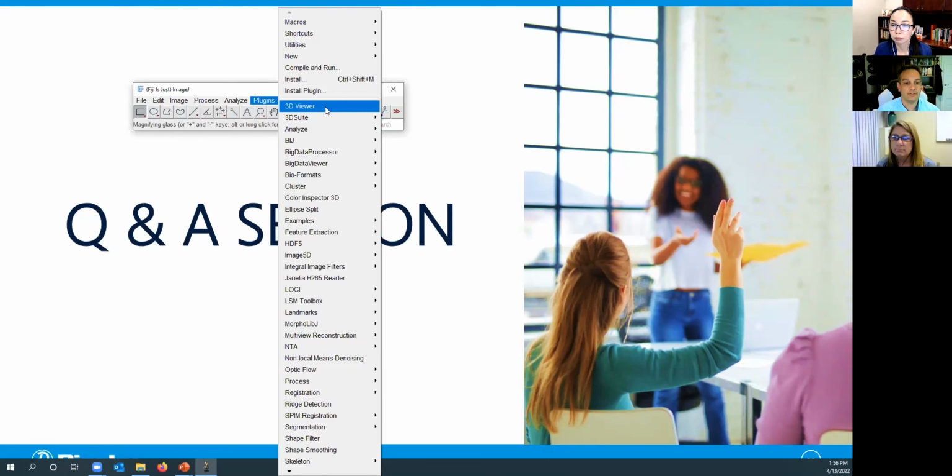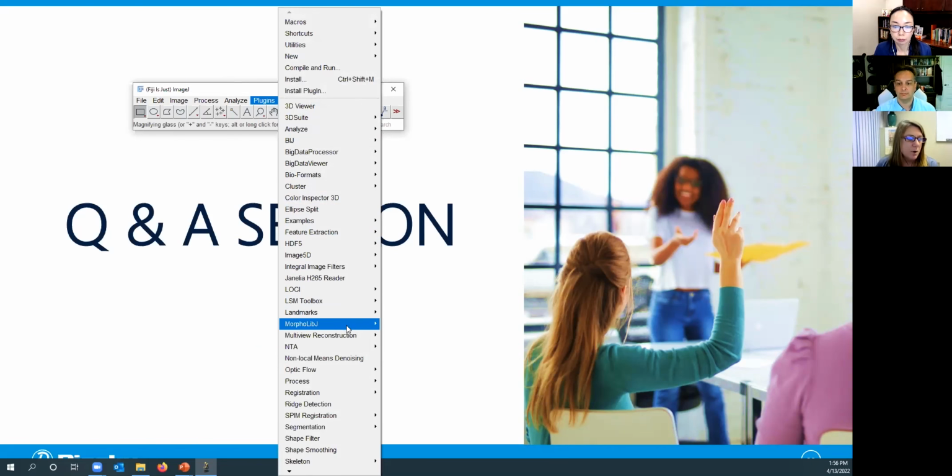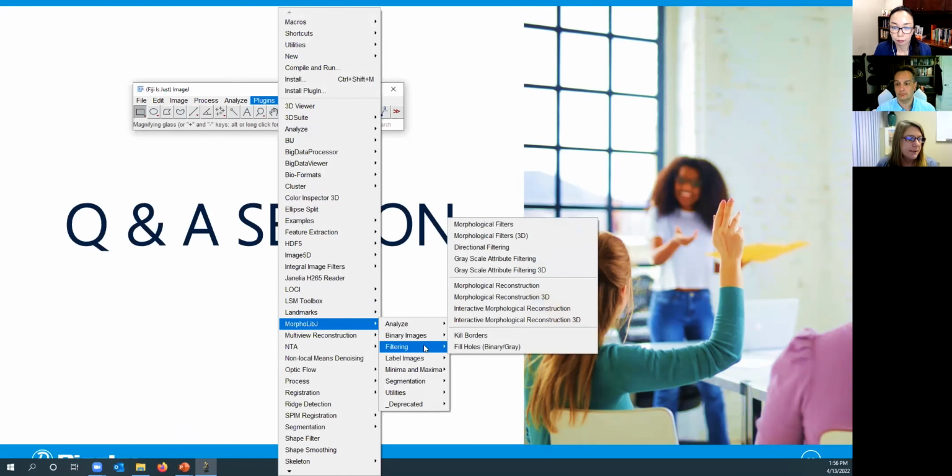Okay, and then the last question is, does MorphoLibJ work on stacks as well, such as processing 3D data? Absolutely. In here, MorphoLibJ is for filtering, you have a morphological filter and a morphological filter 3D, and that's the same for many of the different tools within MorphoLibJ. So if you're working on stacks, you'd use the 3D option. I just use 2D images for expediency for time today.